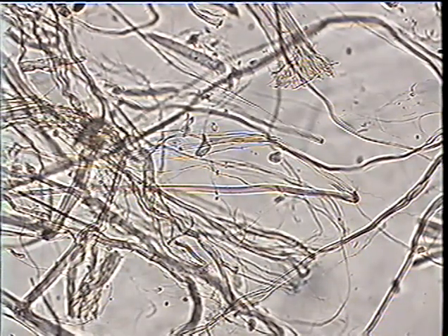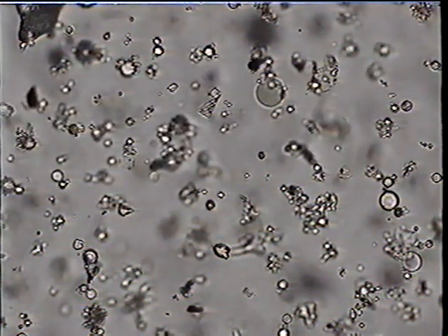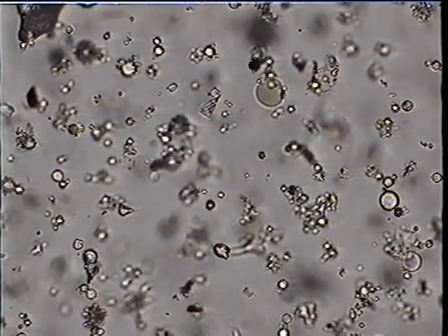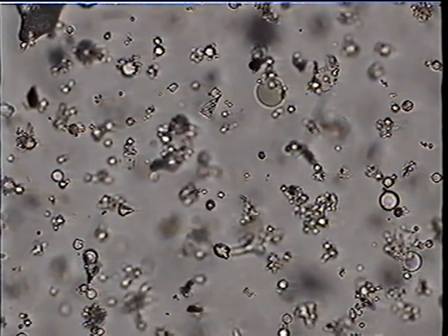Obviously, these are recognizable at sight if you've seen them before and if you have a good memory. These are combustion products. They are pulverized fuel boiler fly ash from an electricity generating power plant. They're completely burned, little glassy spheres of the molten and then solidified ash.